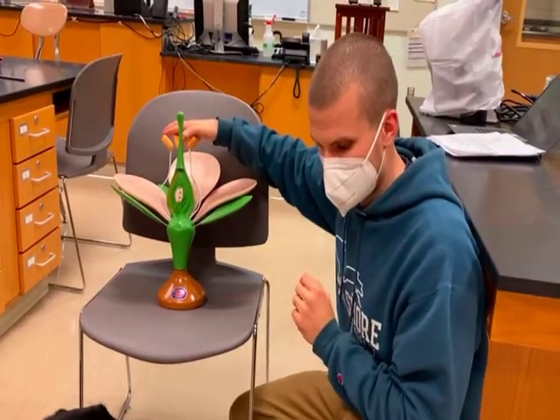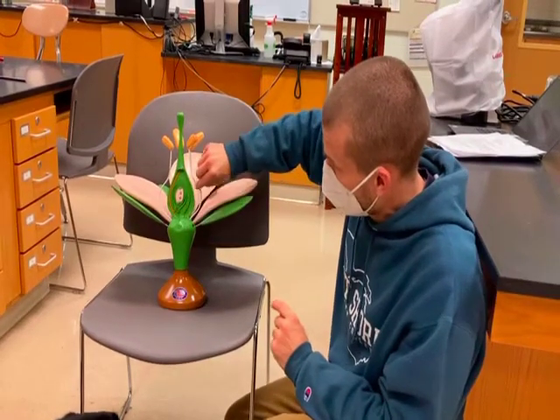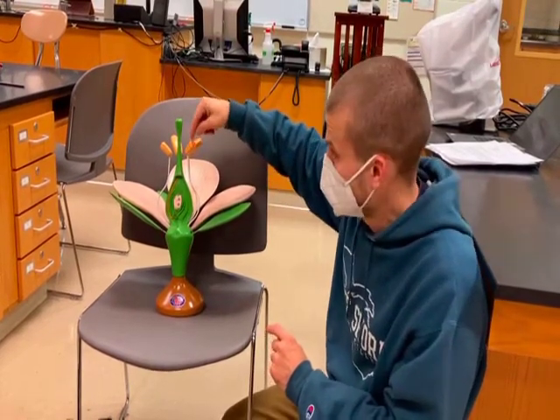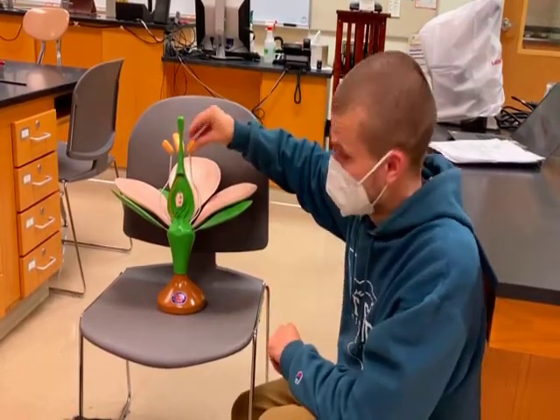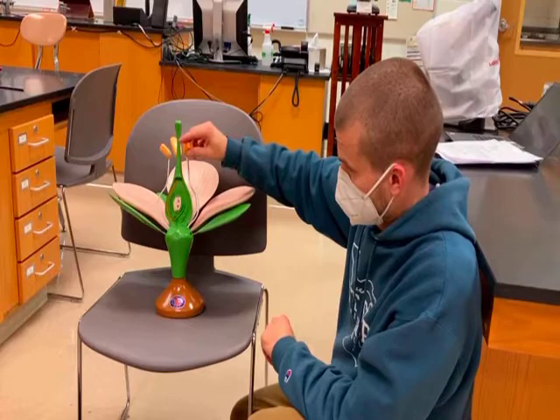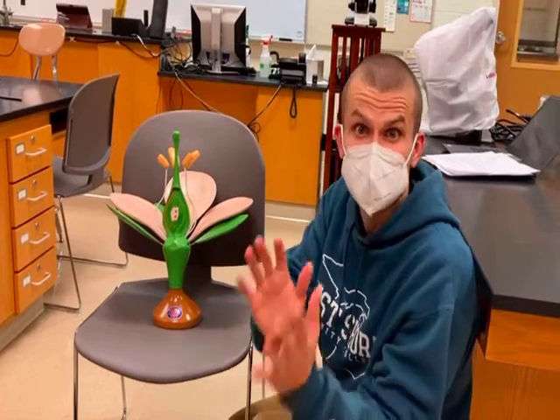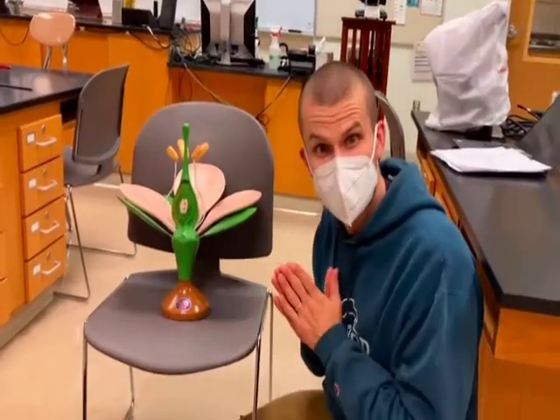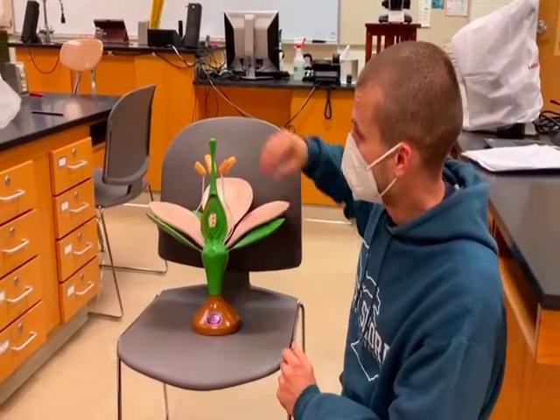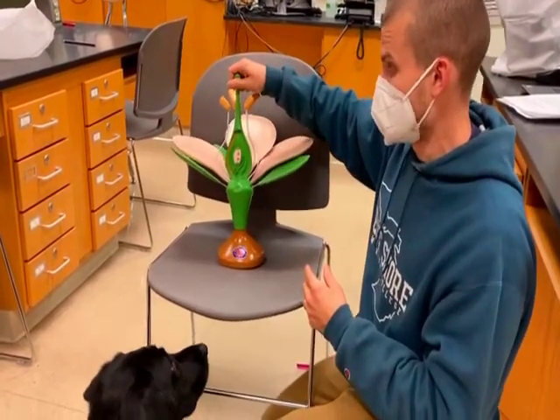The male whorl is defined by two features. The filaments that are essentially long stalks with the spore or pollen producing thing at the tip. This is called the anther. You're always going to have pollen made in these structures. The number of pollen sacs that you get in the anther is actually derived by whether that plant is a monocot or dicot. So think back to our floral buds and think back to how many pollen sacs those different flowers had. Our last central whorl is the female house, the female circle.